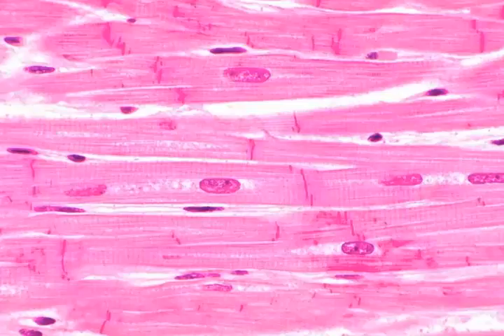This slide is of cardiac muscle. There are a few things you want to notice. One, the direction of the tissue, which does not distinguish it from anything else, but the direction of the tissue is left and right on the screen, and so the muscle would shorten, the left side pulling to the right side. But the thing you want to notice are these lines that are going perpendicular to the tissue.